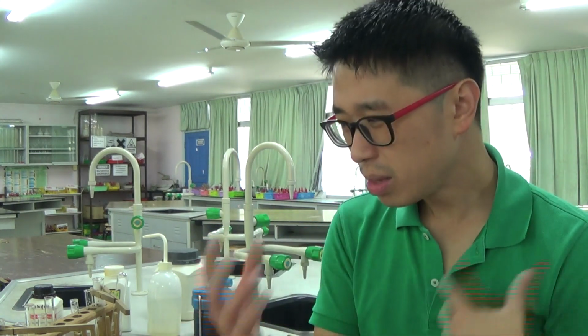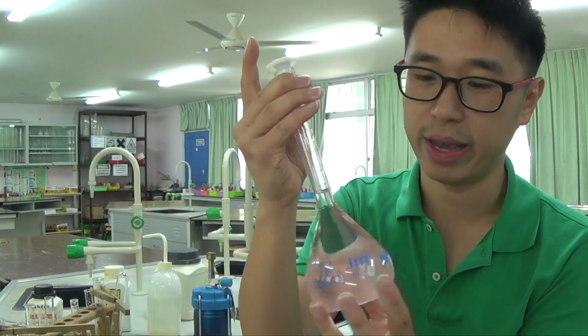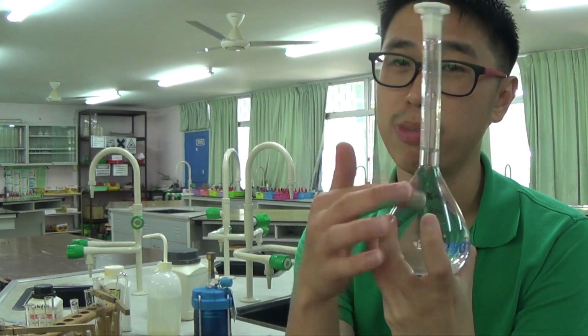Alright, so that's it from me in this tutorial video. It's getting a bit long now. I've done altogether qualitative analysis, but I try to focus specifically on ammonium ions with a particular interest in this thing called ammonium nitrate, which I made up in my other video as my stock solution. It turned out that the concentration was good enough to test for both ammonium ion and the nitrate ion.